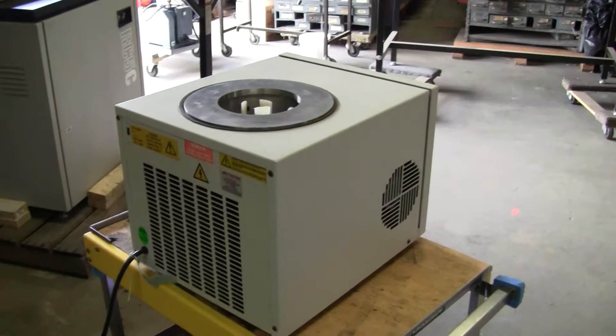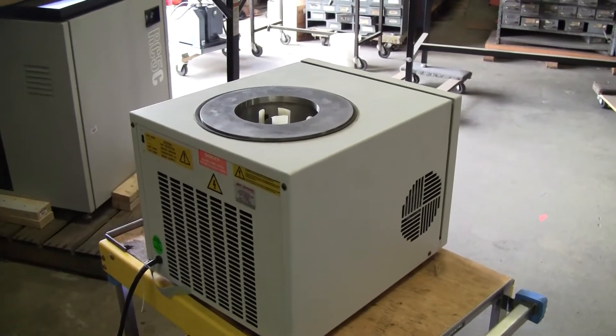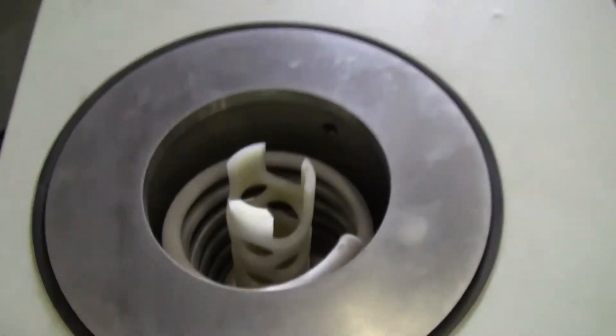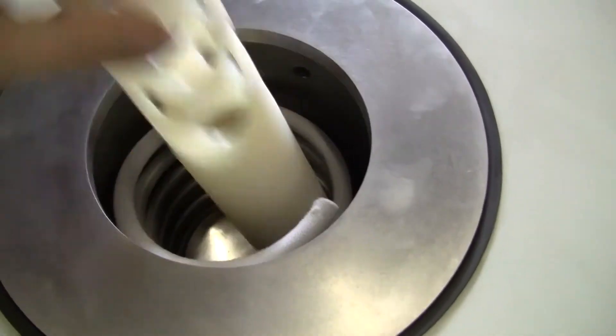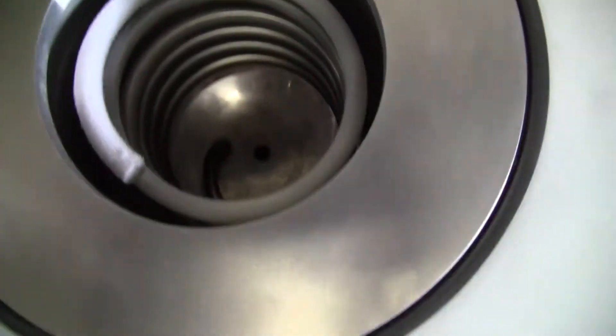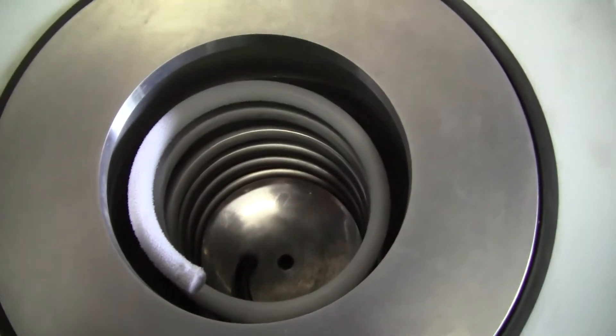This unit can be run off of both 100 or 120 volts. Taking a look inside, this has been running for about three to four minutes and we can already see some frost buildup on the top of the coil. This thing is getting nice and cold.